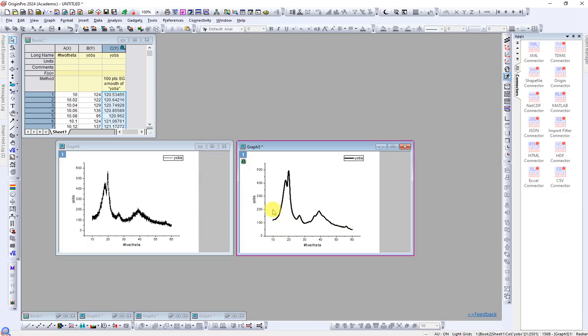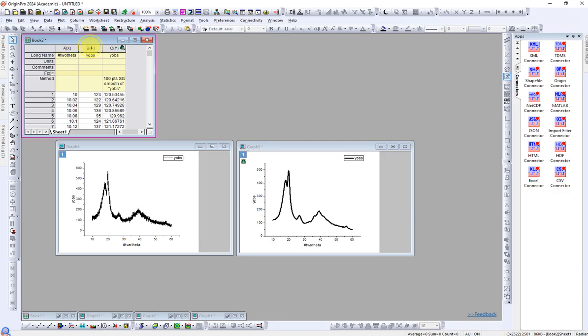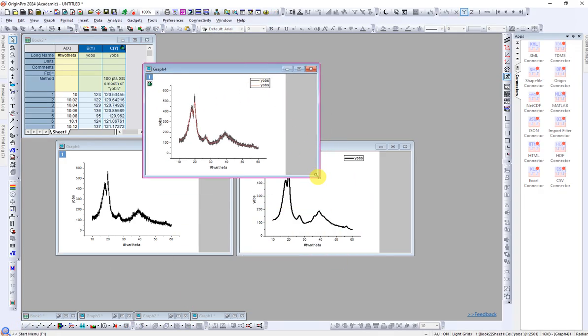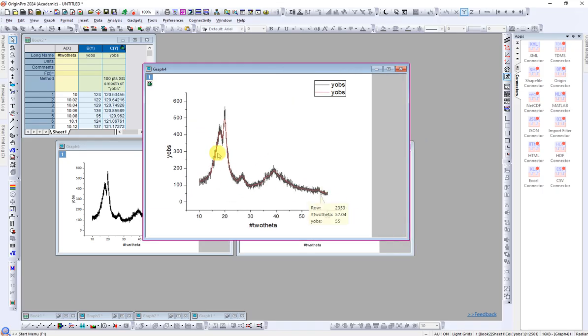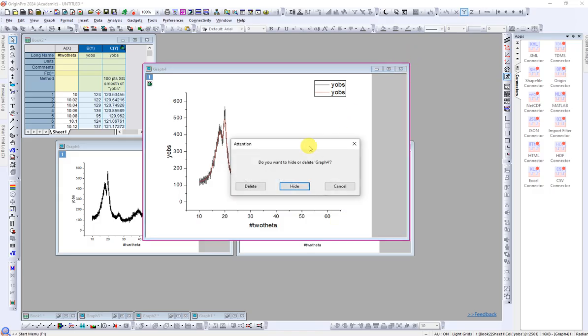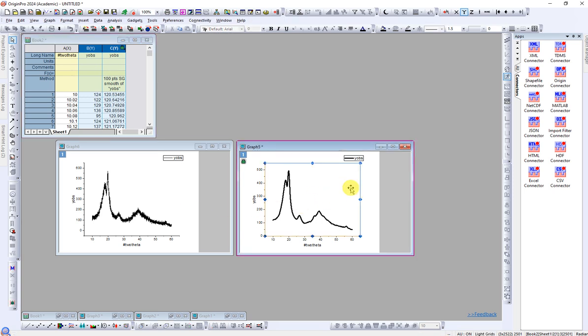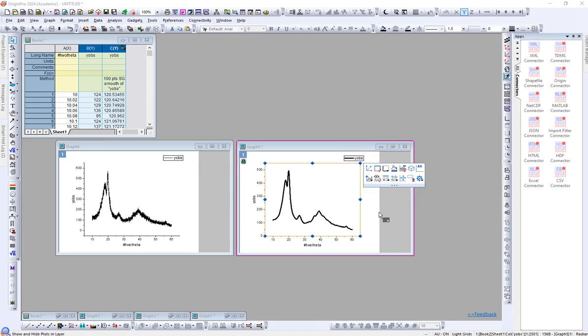If you want to double check that the peak positions are the same, then you have to select both the old and smooth graphs and draw the graph, because in preview sometimes you cannot see exactly. So here you can see the peak positions are perfect. So this is the perfect smoothing of the XRD raw data. So you can use this data to plot the graph for a journal paper, for your thesis, or for your presentation.